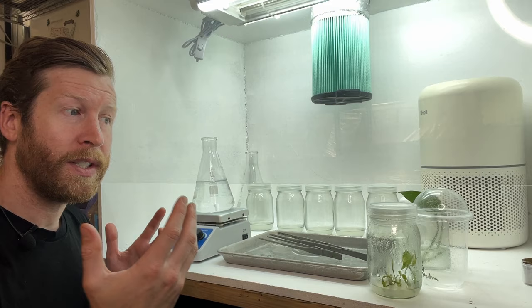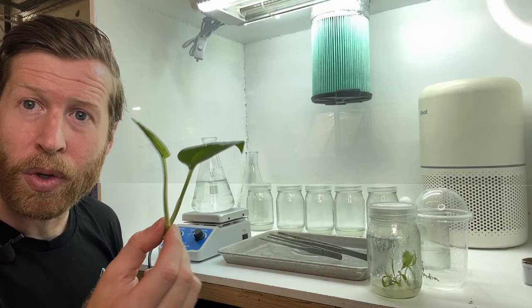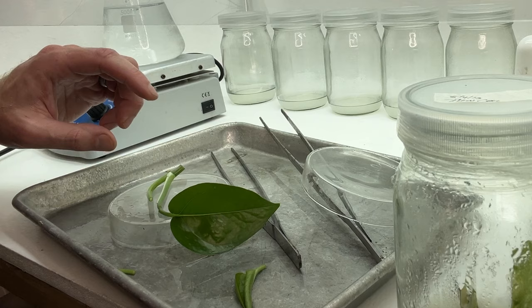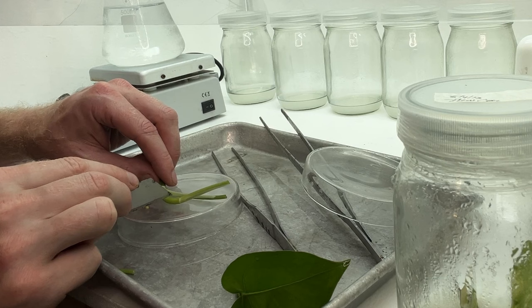Hopefully they are cleaned out before they enter the tissue culture jar and cause contamination. Today, our plant we're going to be using is a typical golden pothos. The first thing to do is to get a part of the plant from the mother plant. This is a simple cutting and it has some roots attached. The first step is to remove the leaves and any sort of excess stems as well as roots. The nodes are what we want to focus on — in typical propagation processes, these are two separate plants.